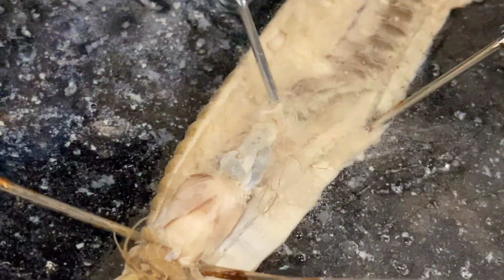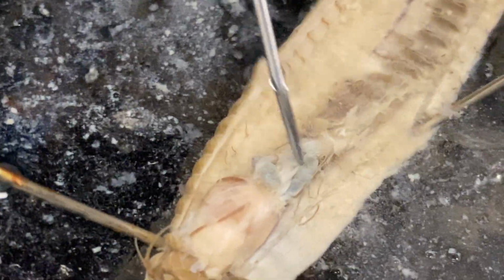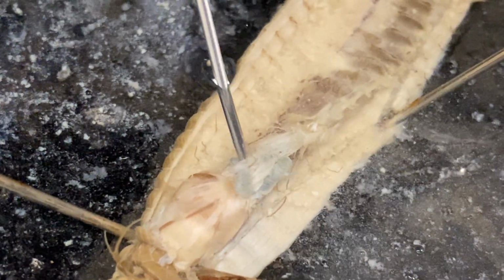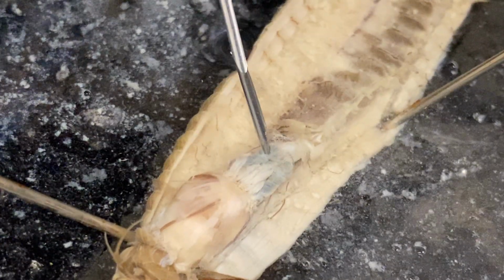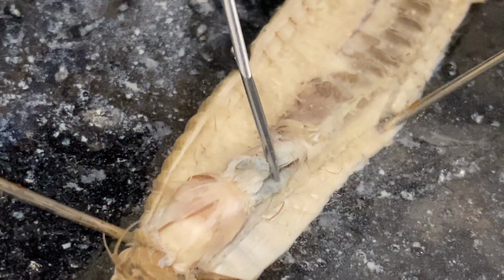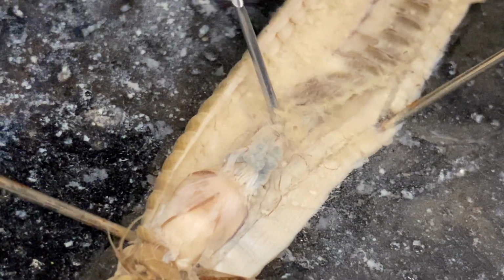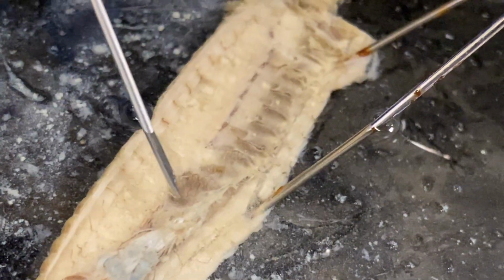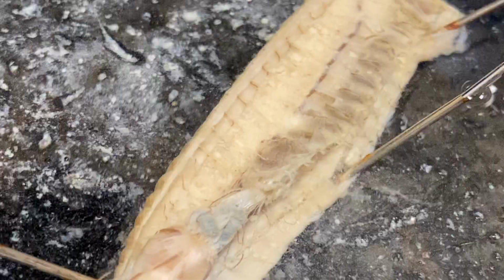It's a little lighter in color and a little lighter in texture. Flanking either side of the esophagus is esophageal cecum, which are these glands coming down on either side. There's one right here and then one right here. They're gray-blue in color. After the esophagus, you'd get down into the intestine, which flows this way all the way through.